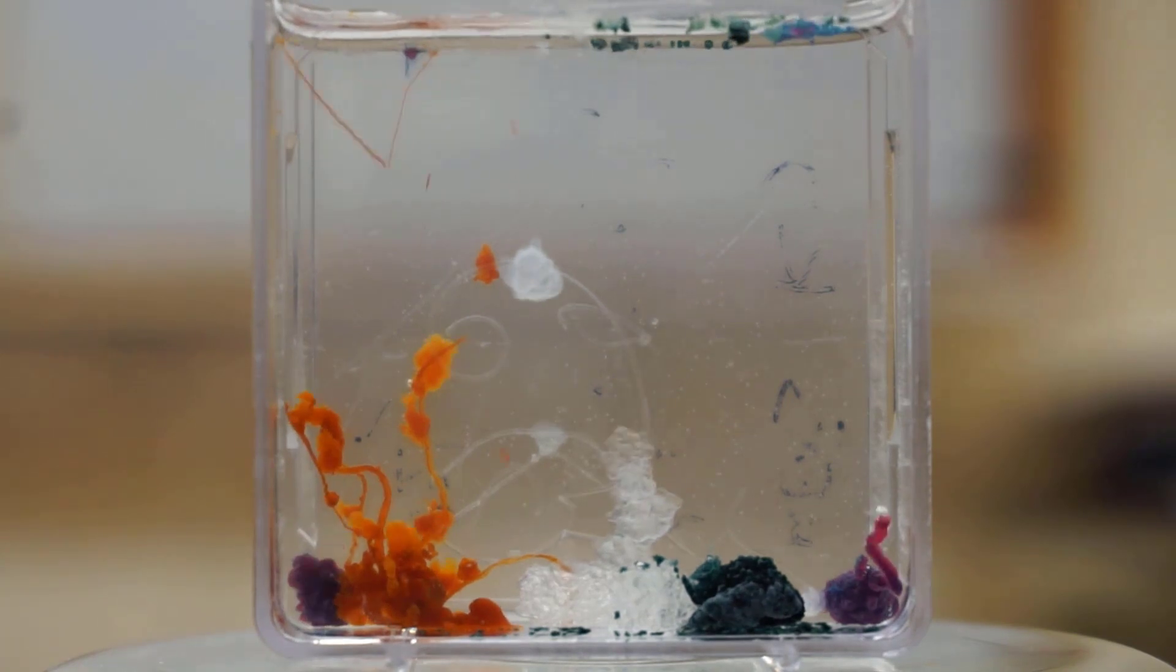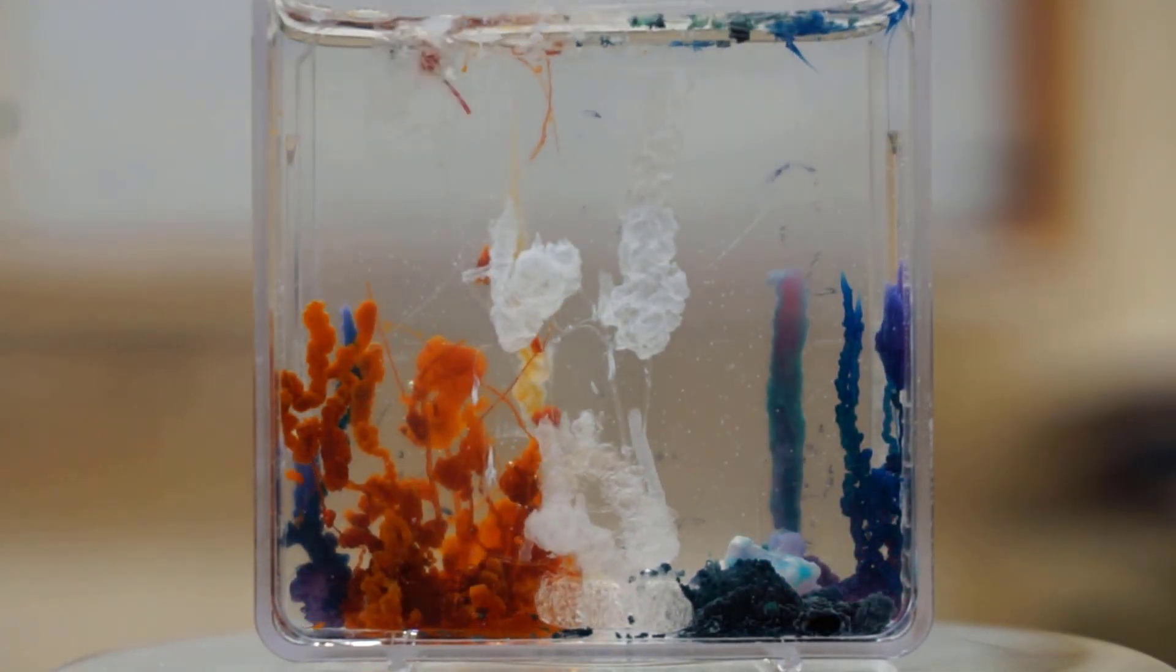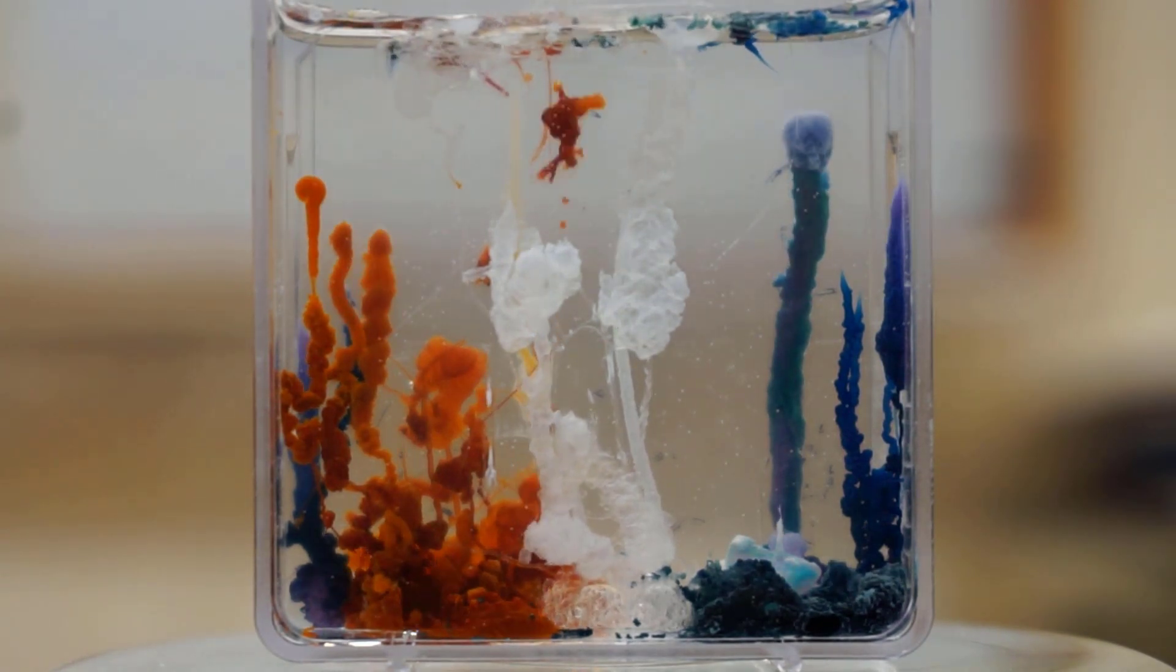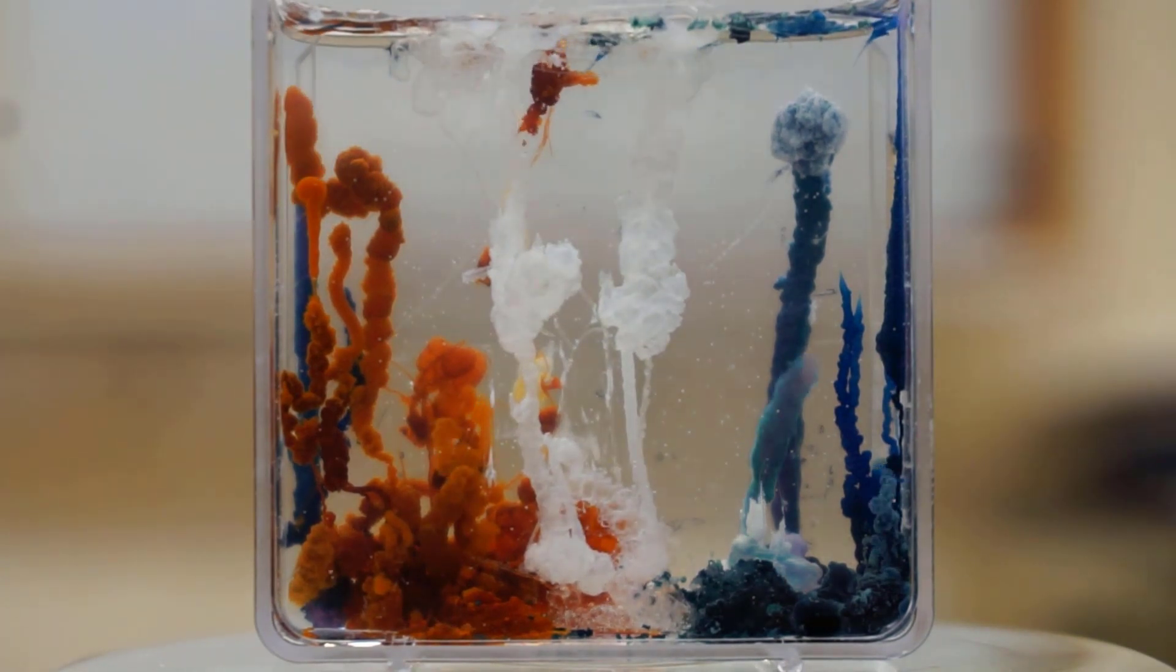These seaweed-like formations expand upwards, presumably to the direction of decreasing hydrostatic pressure, giving the impression of an aquarium full of life.